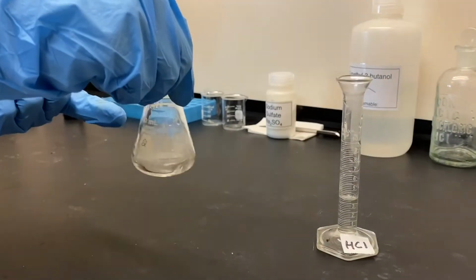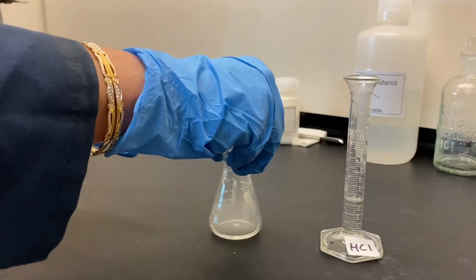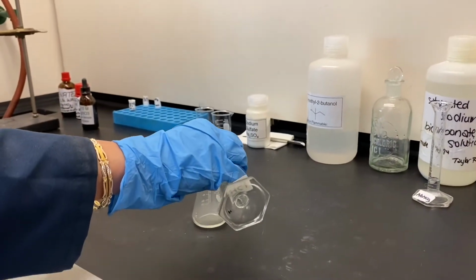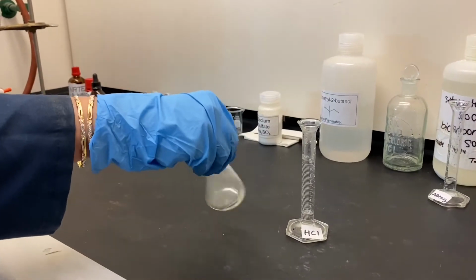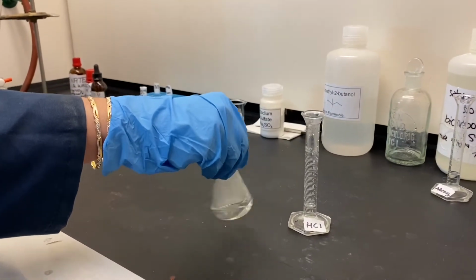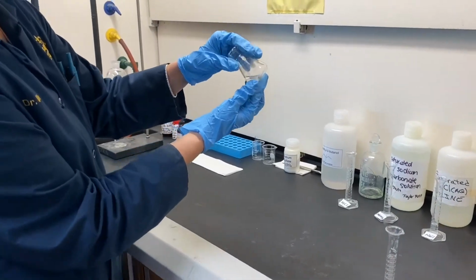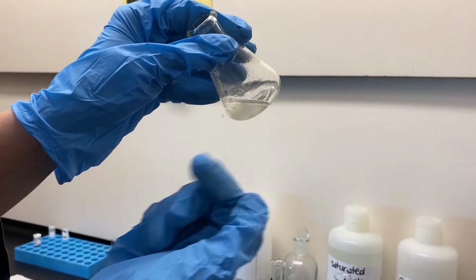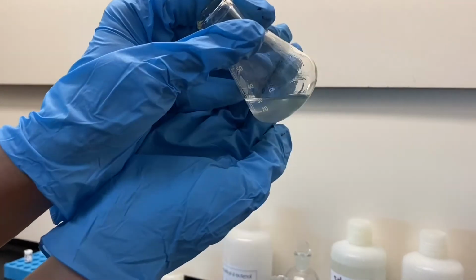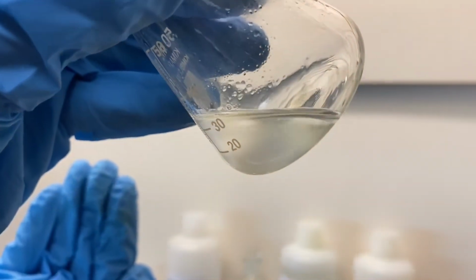The fumes you will see are because of concentrated HCl. I will add a few more portions, and after I've added all the HCl, I will swirl this reaction mixture for an additional 5 minutes. After these additional 5 minutes, you will observe the formation of another layer in the flask during the reaction because 2-chloro-2-methylbutane has very low solubility in water, creating a new organic layer.